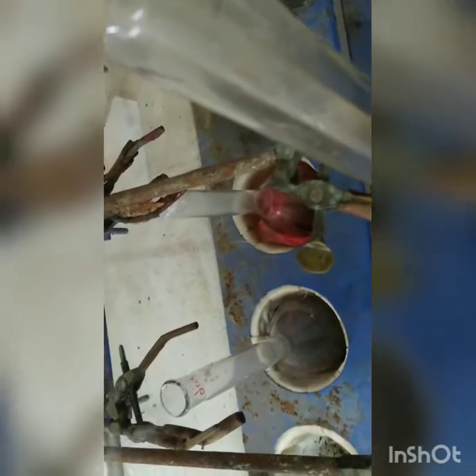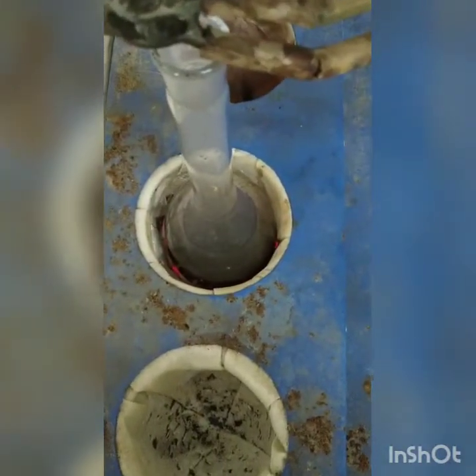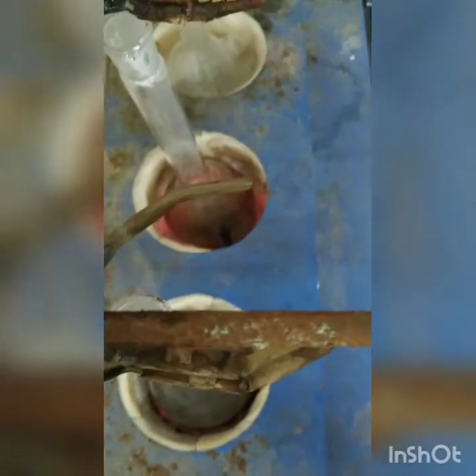Now already 20 minutes are over. So after 10 minutes we will stop the digestion and we will go for distillation. So you can see we are continuing with the digestion process, and the contents in the flasks are getting clearer and clearer. As they have mentioned, about 50% reduction in volume and clear coloring we can see in both the digestion flasks, and of course the third one is our distilled water, and you can see the fumes of digestion clearly coming out of these three flasks.